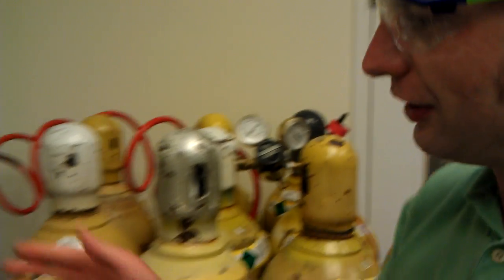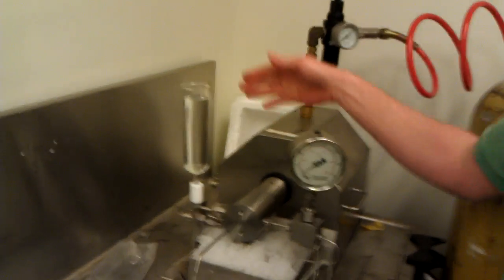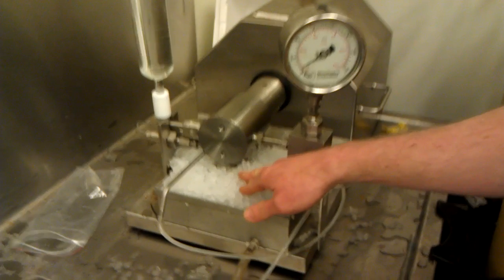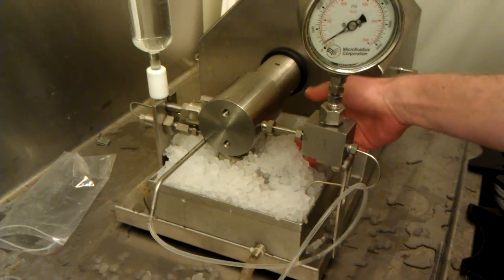Now you'll go here to the actual instrument and your sample will go in here into the funnel. The ice goes in here. Make sure that all the coil is packed full of ice.